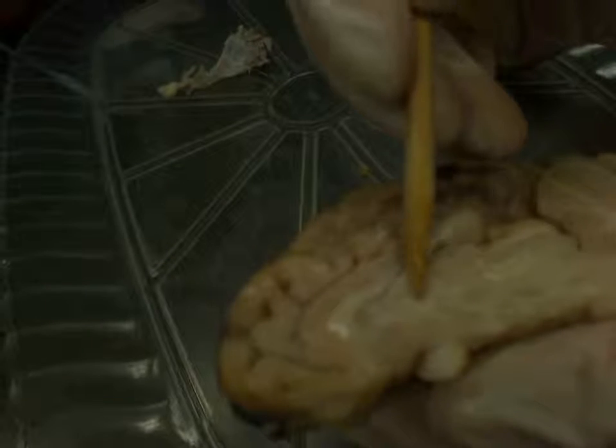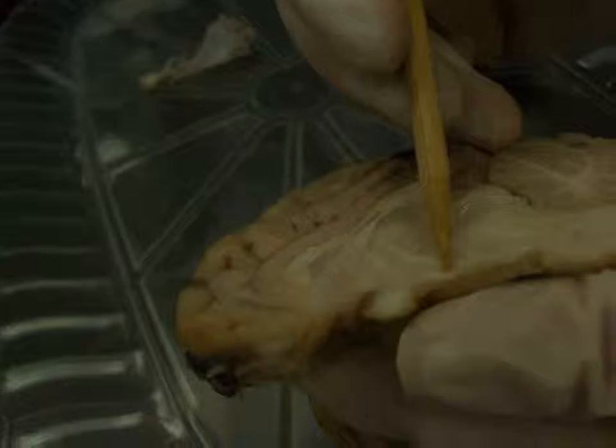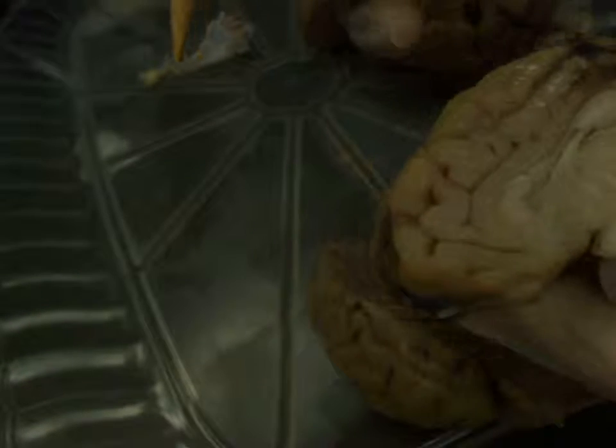So you can see a bit of the white matter tract here of the fornix. It's a slightly better example in this brain. Here we can truly see the full arch of the fornix. So starting up here, coming all the way down, wrapping all the way around, and hitting the mammillary bodies here. Okay. Let's see. What else do I need to see?